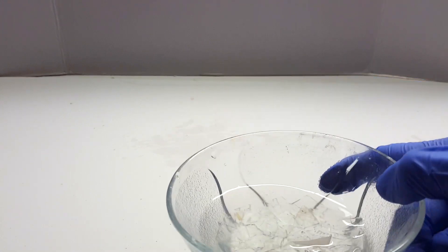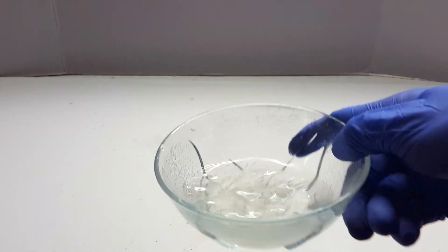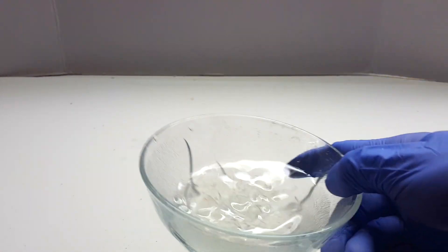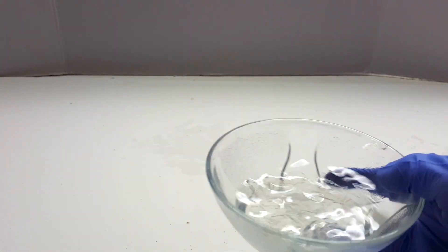In most cases, the acid wash is enough to clean the glass. If not, however, a base wash can be used with just substituting sodium hydroxide solution instead of hydrochloric acid.